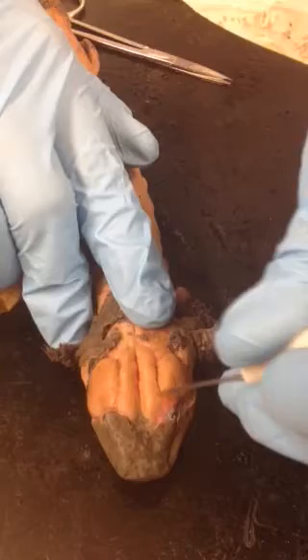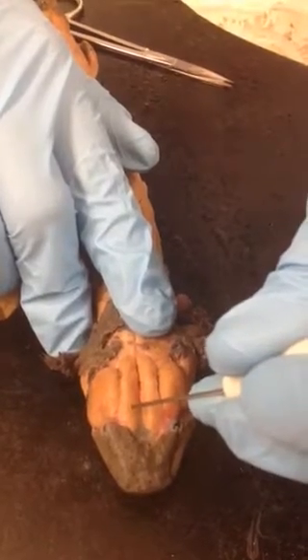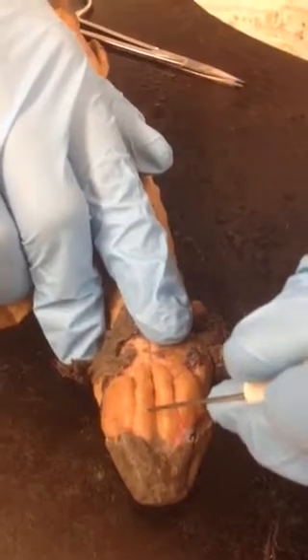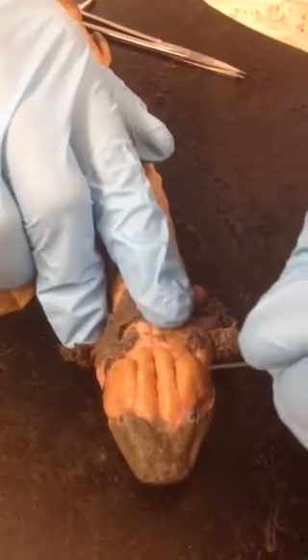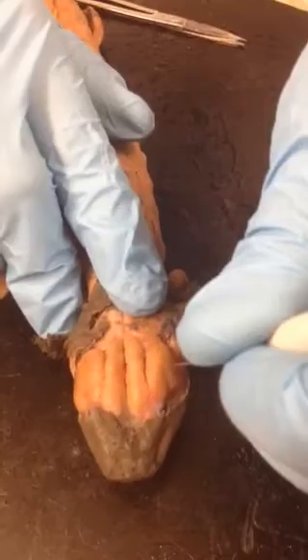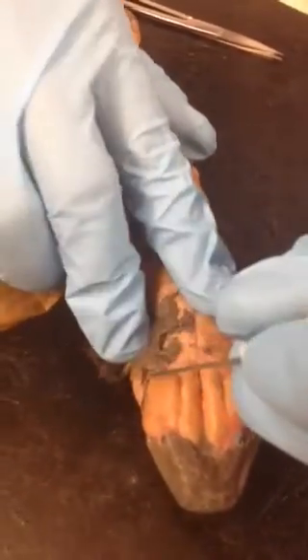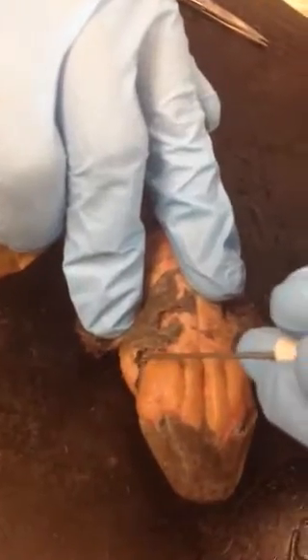This one down the center and right here, that's the anterior mandibular levator, also known as the anterior mandibular adductor. This one right here on the side, external mandibular levator or adductor. Back here, this one's got some fascia over it, but that's the mandibular depressor.